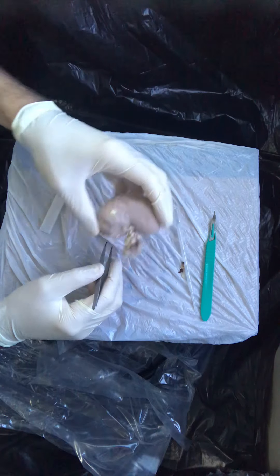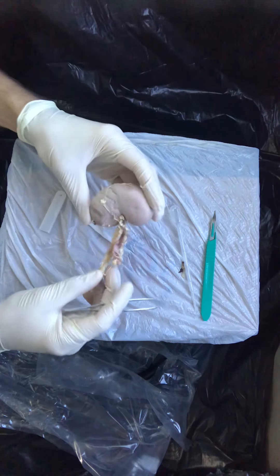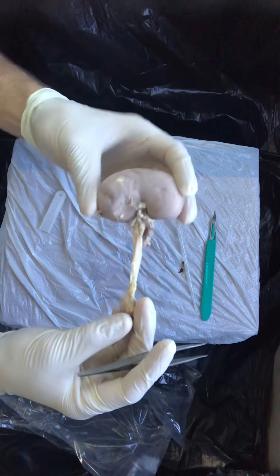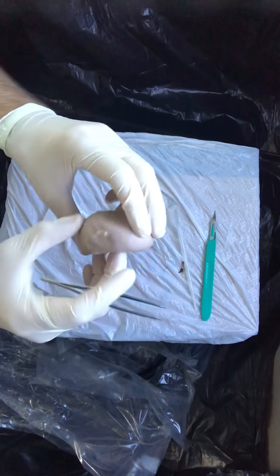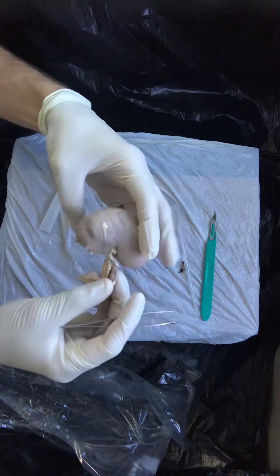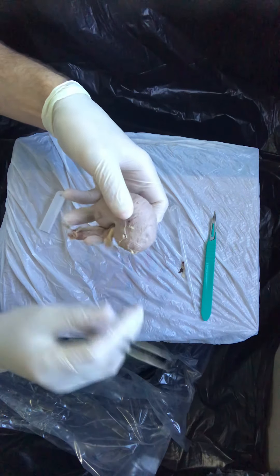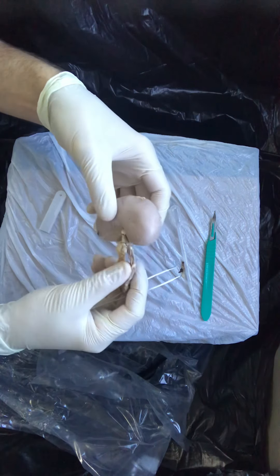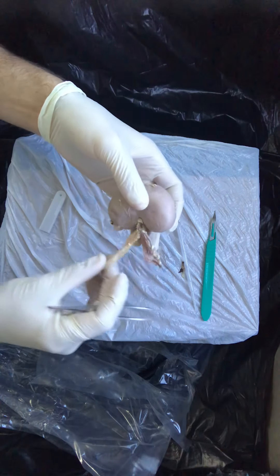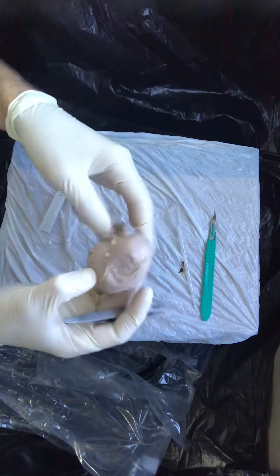When you're looking at your organ, I think the first thing that you're going to notice is that the kidney's shape, the gross anatomy — the shape or what we call the morphology of this organ — is pretty true actually to what we see in the diagrams and in the human cadaveric dissections. This is a sheep's kidney, but the things really are quite true.